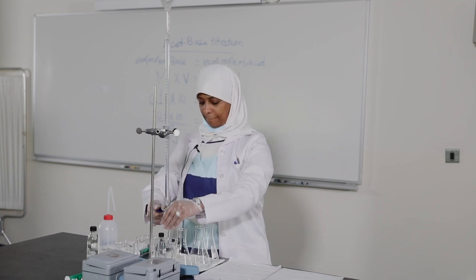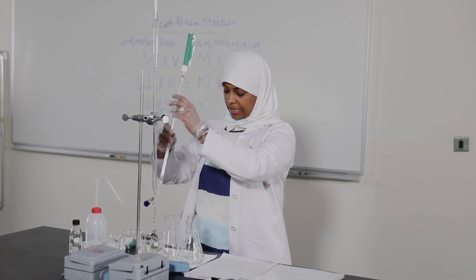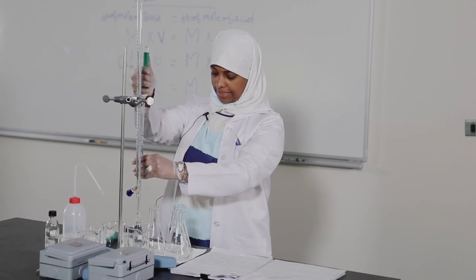We make sure the solution is exactly at zero. After that, we start filling the flask with HCl using the pipette and pipette filler — 10 mL.